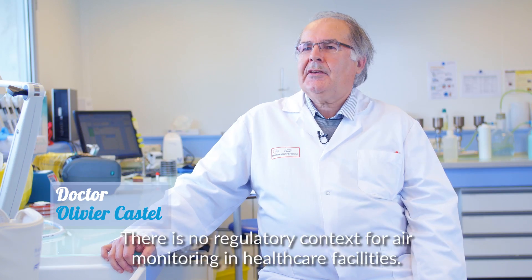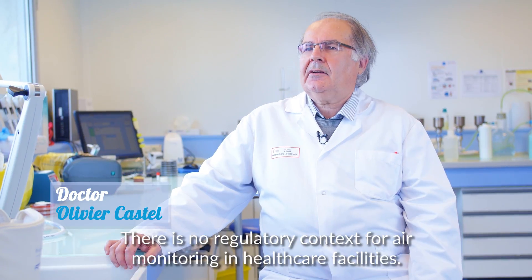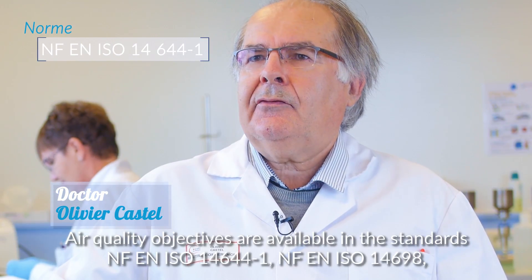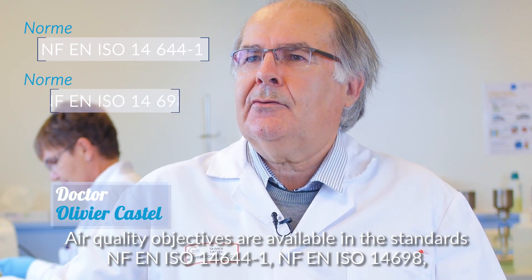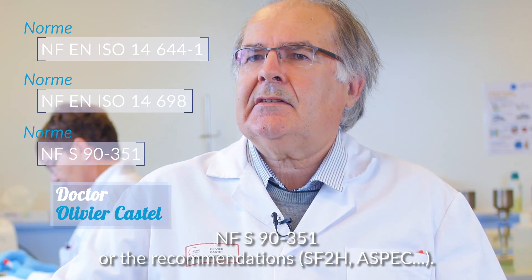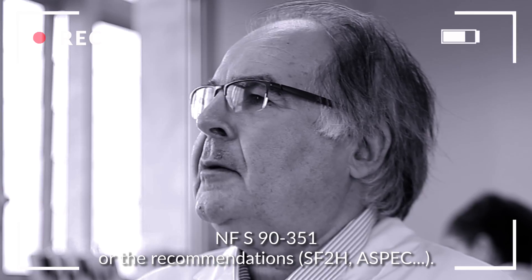Two sampling techniques are used to search for particles or microorganisms in the air: particle count and aerobio-contamination measurement. Air surveillance in healthcare facilities does not benefit from a specific regulatory framework. Air quality objectives are available in standards NFEN ISO 14644-1, NFEN ISO 14698, and NFS 90351, or in recommendations from SF2H or ASPEC, for example.